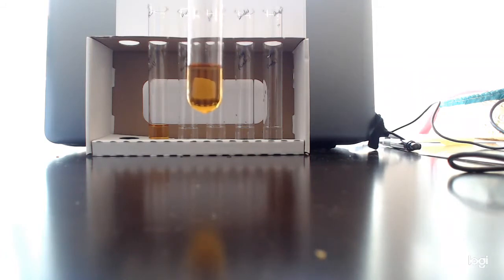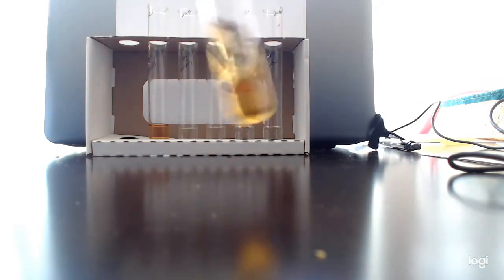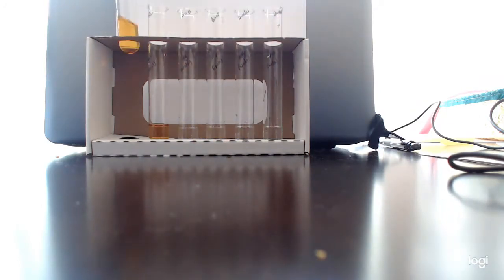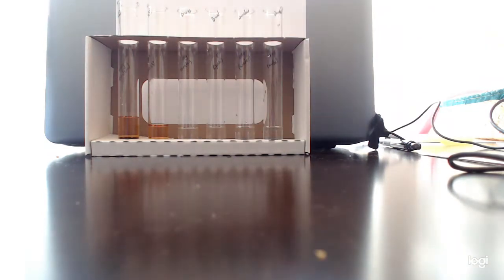1, 2, 3, 4, 5, and so on up to 20 drops. Okay, and you can see it stays this brownish, yellowy, orangey color, so no color change, as we expect for a negative test. A negative test just means that the molecule we're looking for is not there. For potassium iodide, we're looking for starch, and of course our water, our negative control, does not have any of that starch molecule present, therefore it stays that orangey brown color.